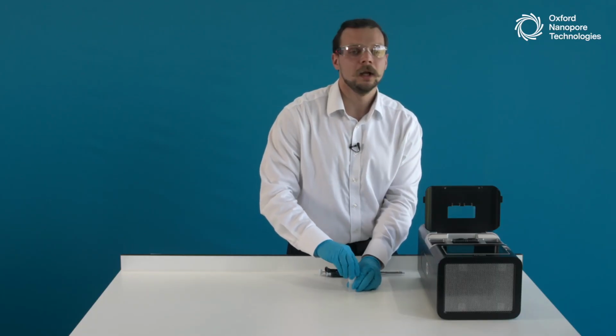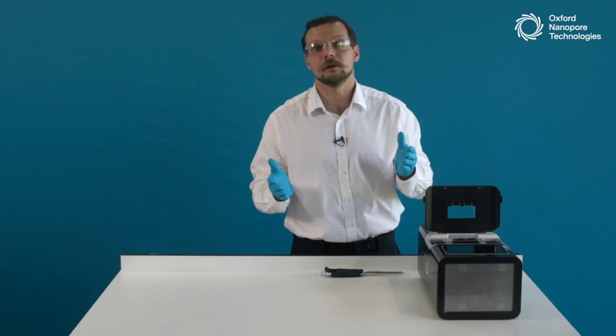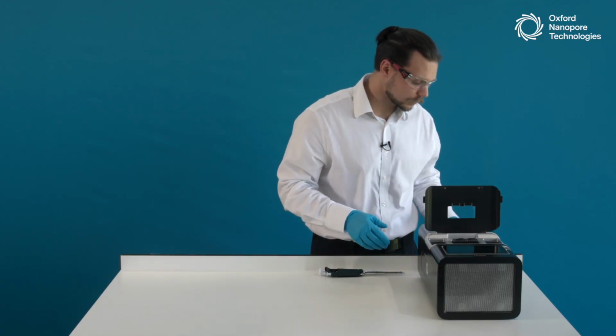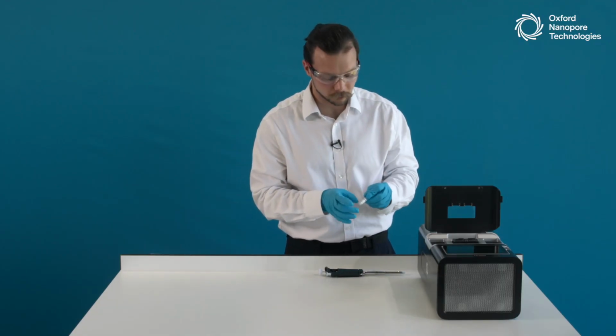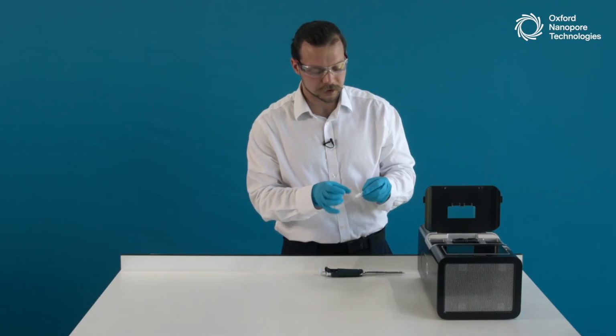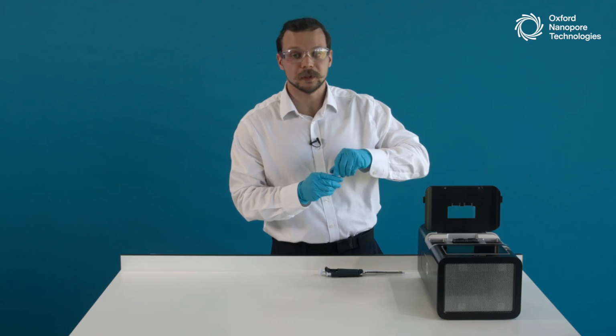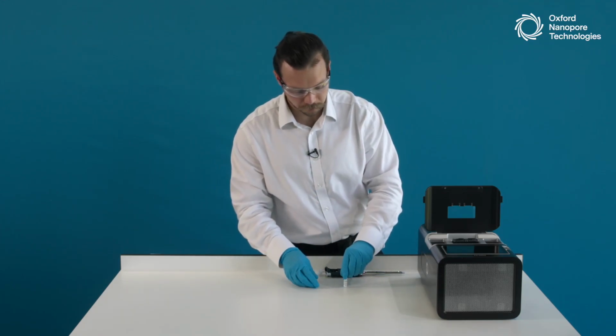At this stage, once we've done 2 steps, once we've put in a total of 1 milliliter of buffer through the flow cell, it is ready for loading the DNA sample. And today, as my DNA sample for this demonstration, I will use the library loading beads, which is what the beads that normally would go into the library.